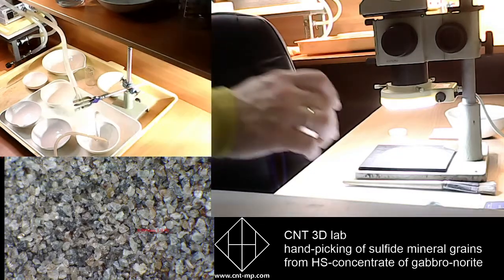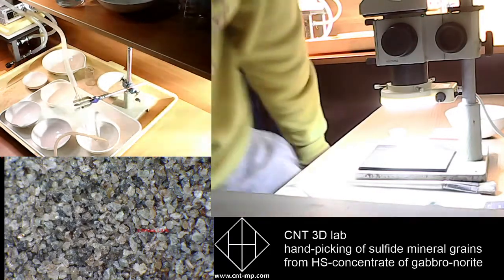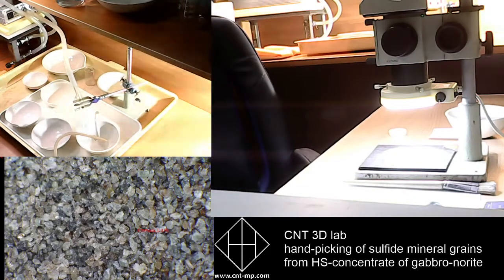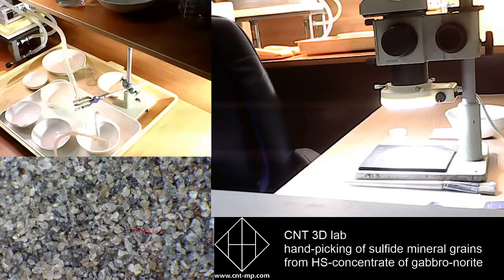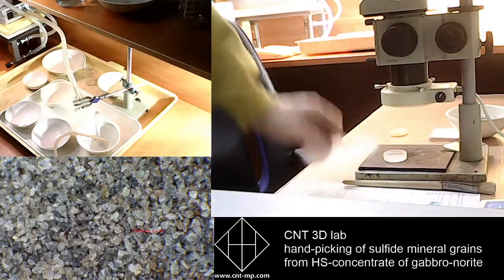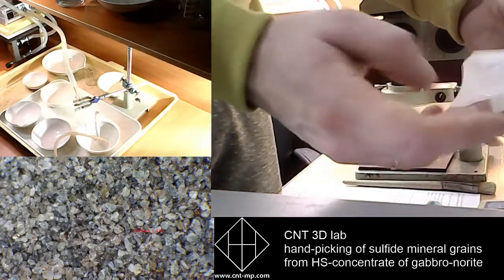So we take all our collected grains. Also, I would like to show you the special pack we use in our studies for transporting the final material. Okay, looks like that. This is a special paper bag.